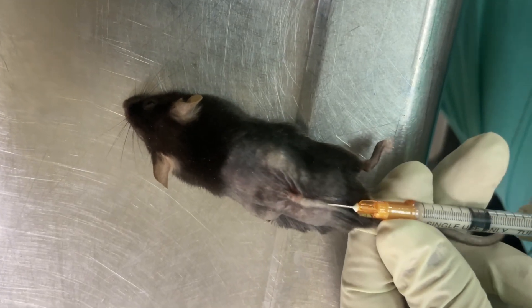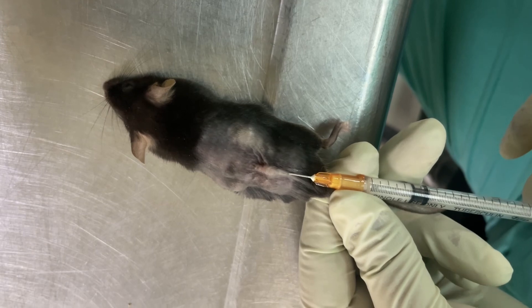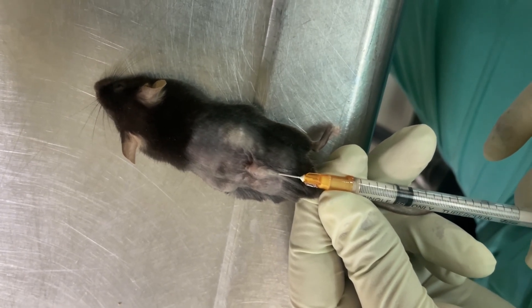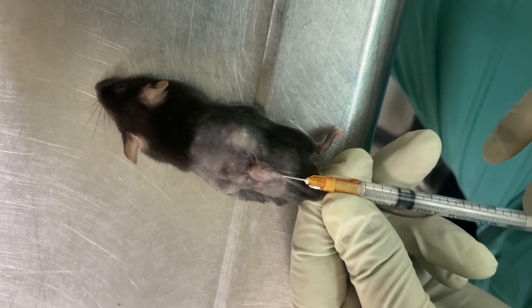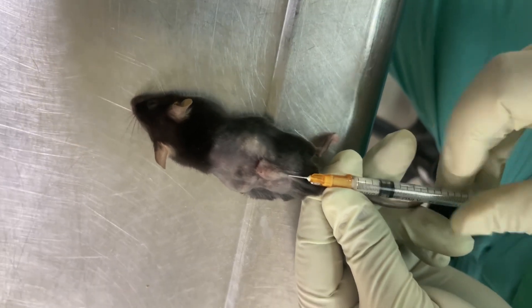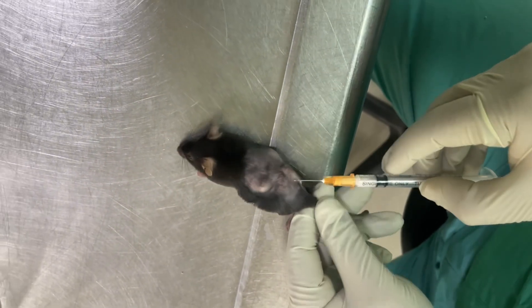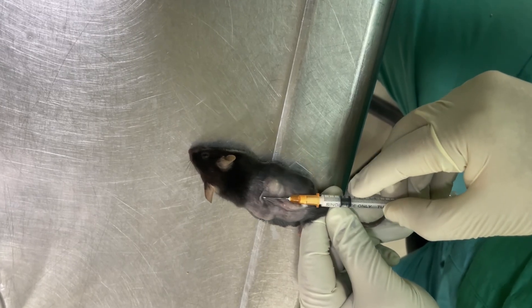In order to inject the mice, we will insert the needle subcutaneously slowly and then uniformly inject 100 microlitre of drug at one site. Then take out the needle and inject at another site.